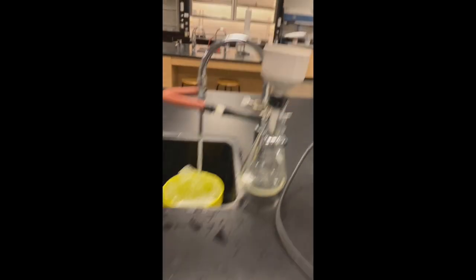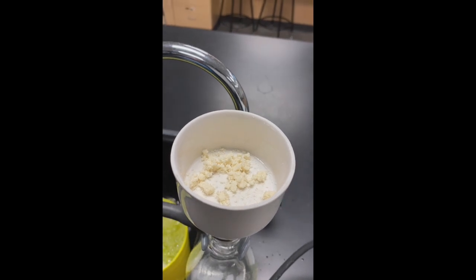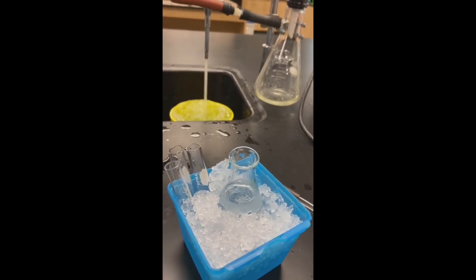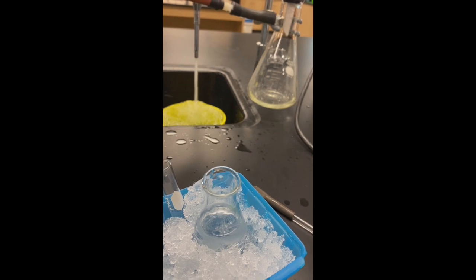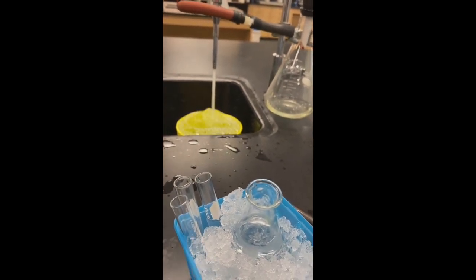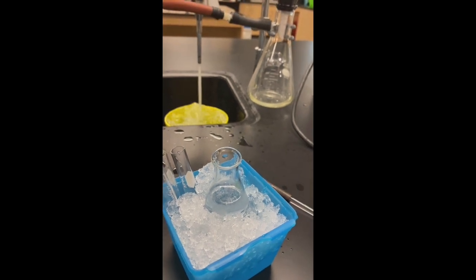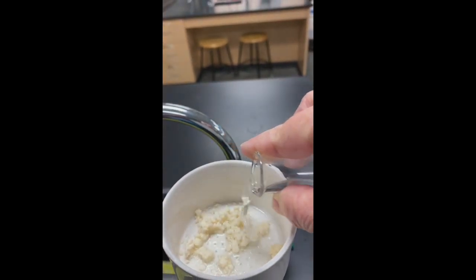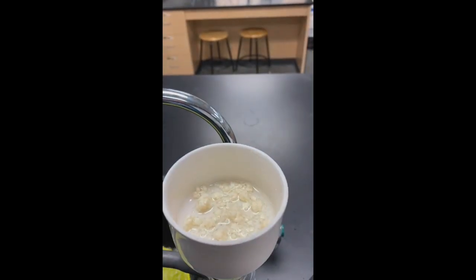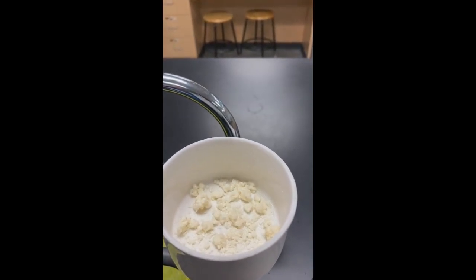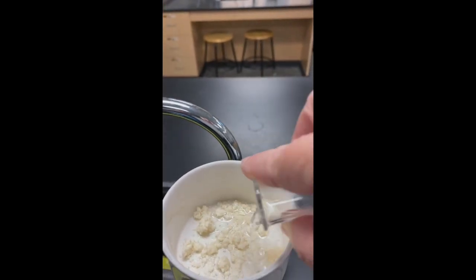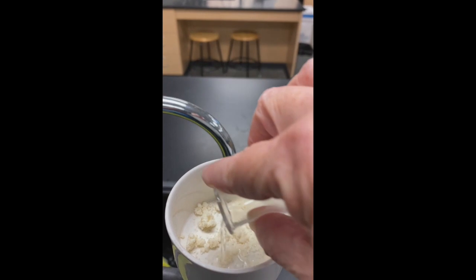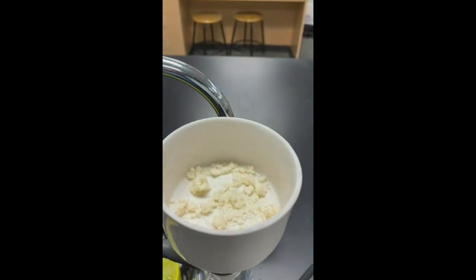One of the first things I'm going to do with my crystals is I need to wash them because they still have that acid on them and I'm going to wash them with cold water. In my ice bath, I've had to put more ice in it during this experiment. I have my water here and I have my five mil portions of methanol ready to go. They all need to be cold. So I'm going to rinse and this is called washing the precipitate. I'm going to make sure I get water on all of this because I want the acid that's stuck on that precipitate to be washed off. I'm going to do this about three times. You can see I'm putting just enough in to get it wet and letting the filter do its work. One more time, this should probably do it pretty well. So that's called washing the precipitate.